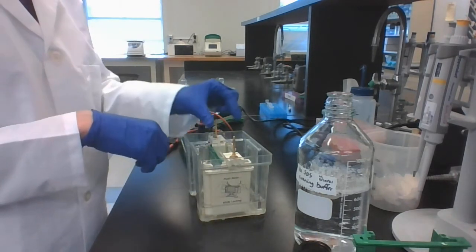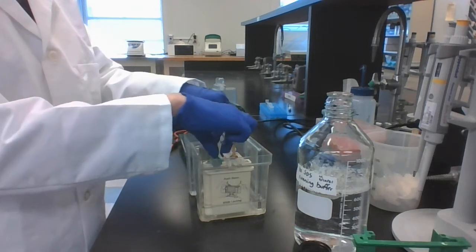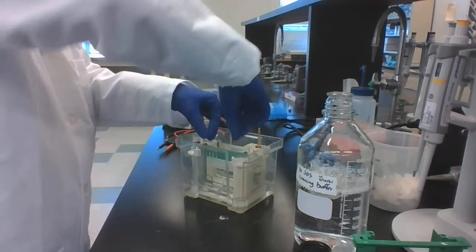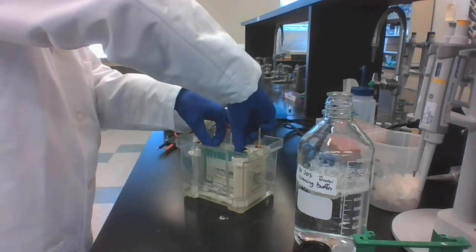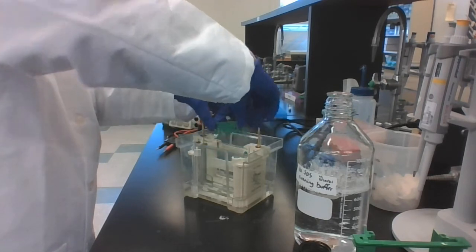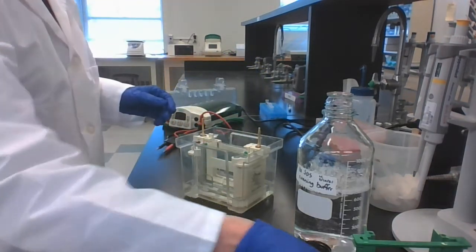Now you can take out the comb. You want to do this gently and straight so that you don't bend the wells. Carefully take that out very straight. Put that to the side.